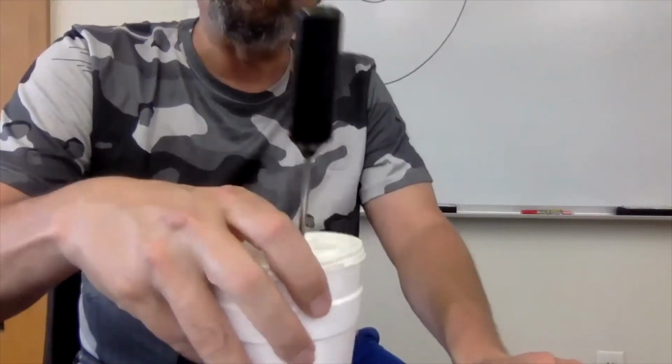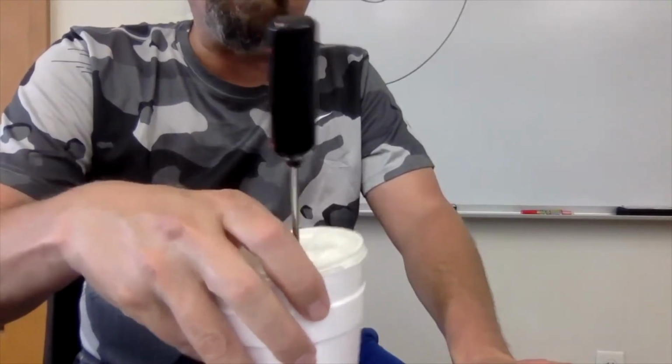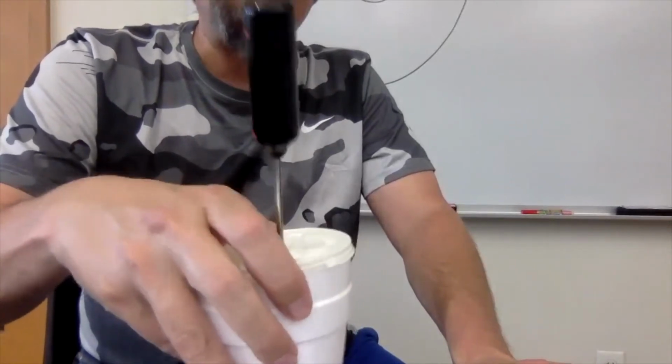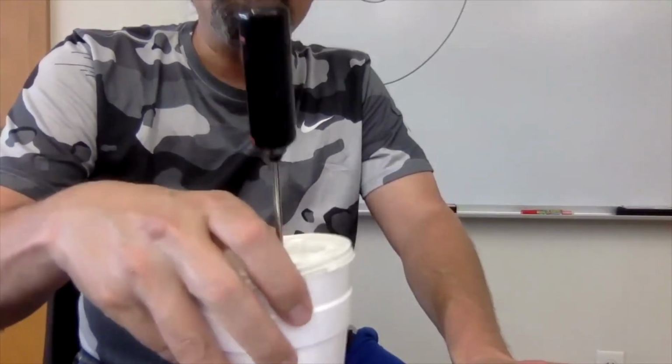And it's starting to go. It's gone up close to 2 degrees C at this point. It's still going up, so I'm going to keep stirring. I don't hear it clanking as much, so maybe the solid's getting close to being completely dissolved, because you don't want to stop until it's all dissolved.